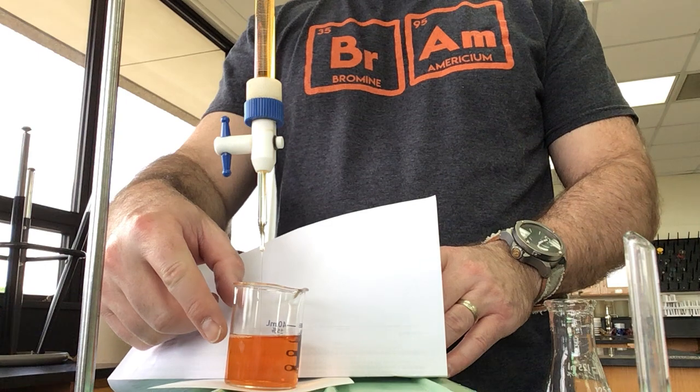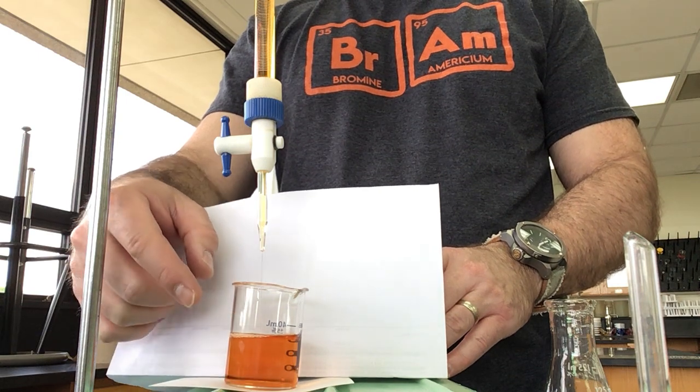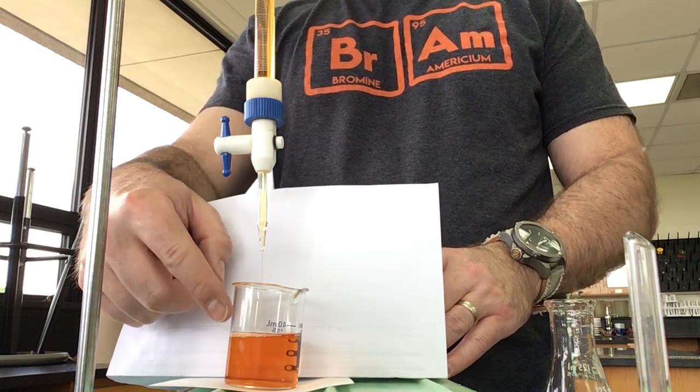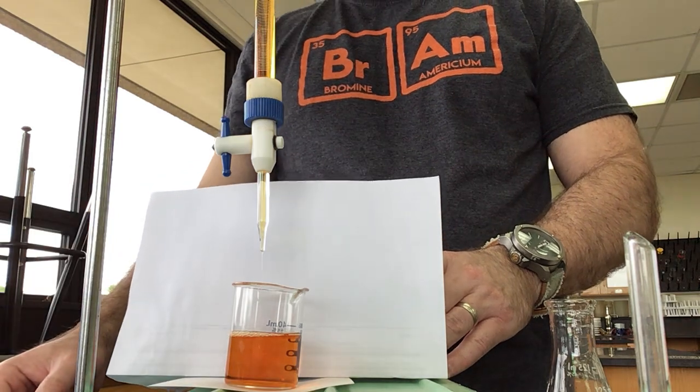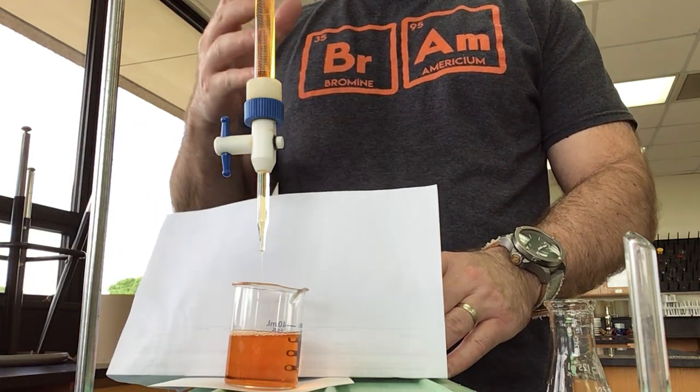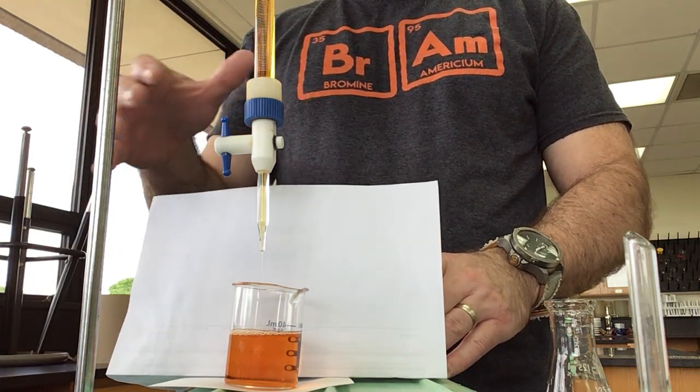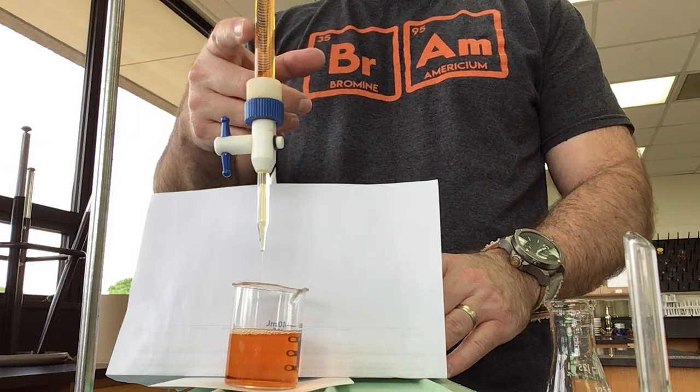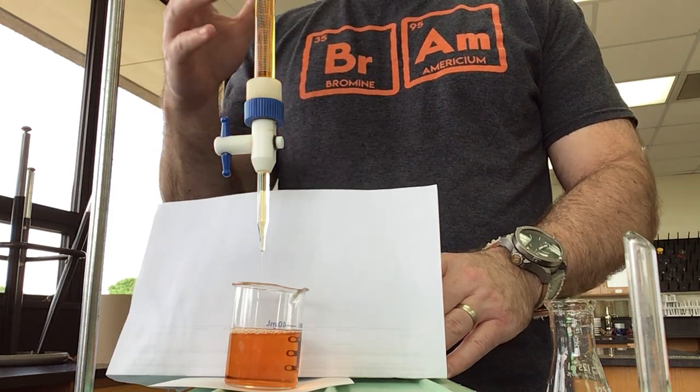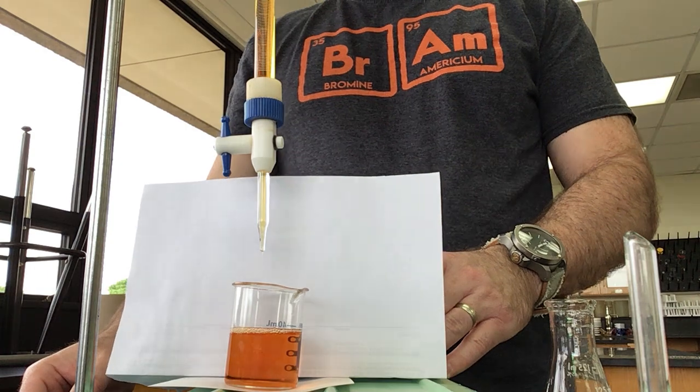We'll be able to use this for our next class or for a different class. So we're going to drain this out and clean that. In college you probably wouldn't reuse any kind of titrant in case this somehow was contaminated, but for what we're doing it's totally fine.